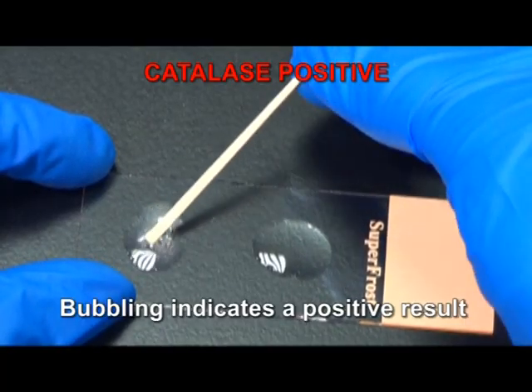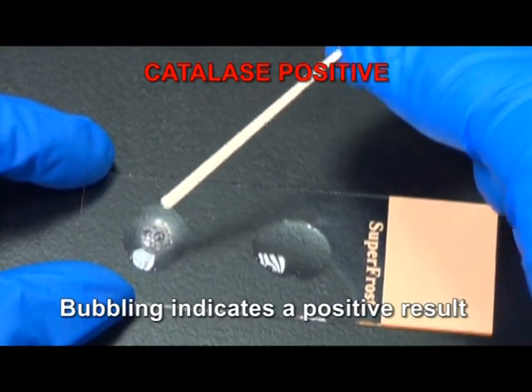If catalase is present, bubbling will occur as oxygen is produced in the decomposition reaction.